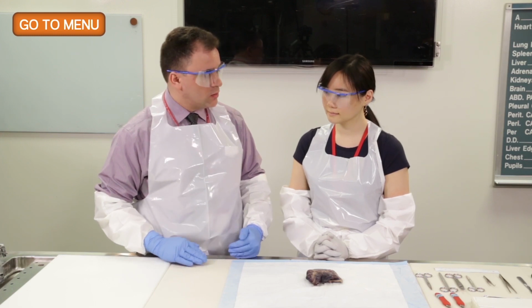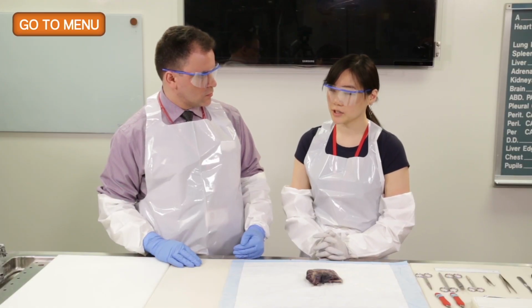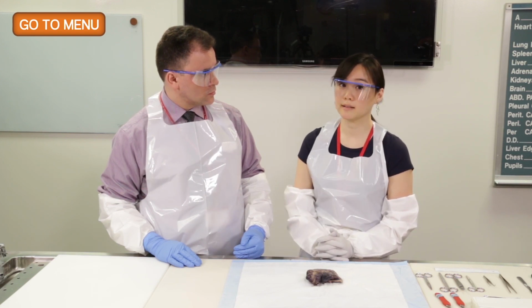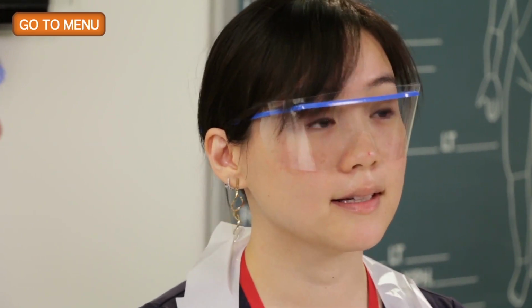Now, if the radiology on the particular patient showed something on the order of a solid lesion, how would that affect your thinking? Well, solid lesions can mean a multitude of things, but one of the most important is probably cancer, of course, and then also granulomatous disease. But if it's semi-solid, you also think of cancer as well, and of course, ground glass lesions can be another multitude of entities. Now, how will that affect your approach to the specimen? Well, if it's a solid nodule, I can suspect that I can actually palpate the lesion. And from there, I can do gross measurements of the largest length.